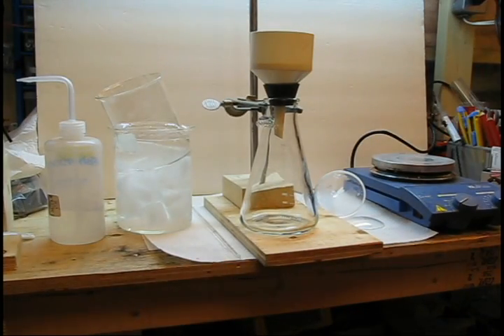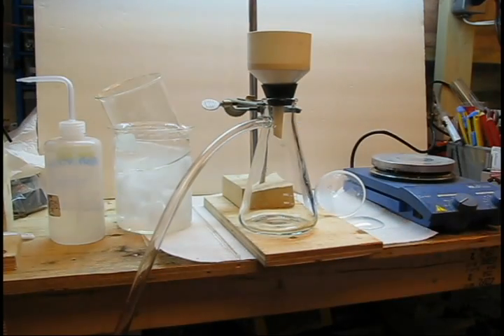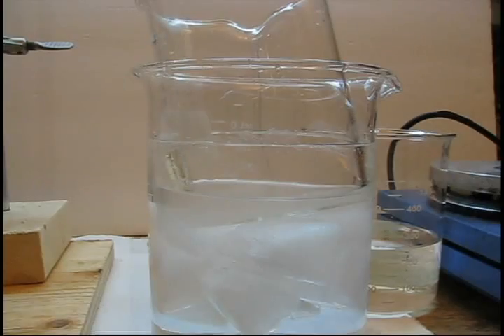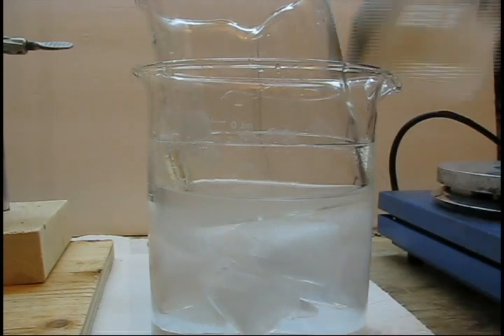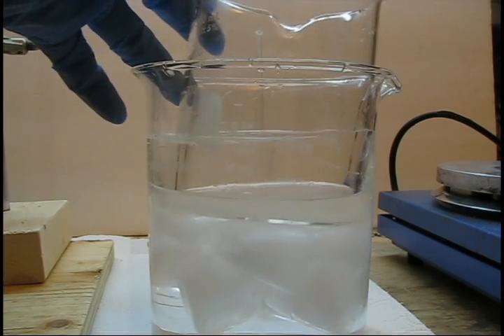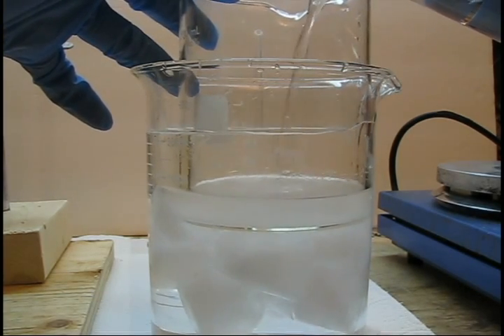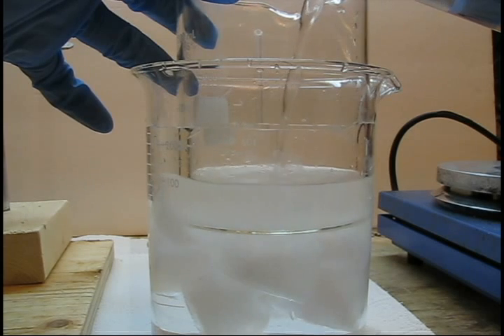Also, at this point in time, you should measure approximately five times the volume of your isopropanol in ice-cold distilled water that you cooled earlier. Add the ice-cold water to the ice-cold isopropanol. This will cause the acetylsalicylic acid to precipitate as it is insoluble in water.